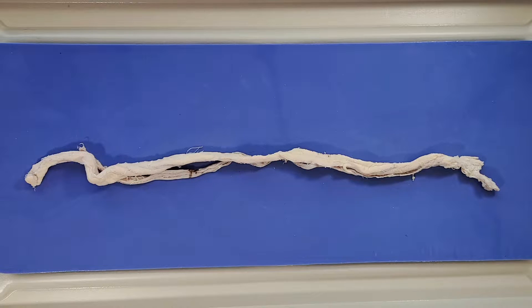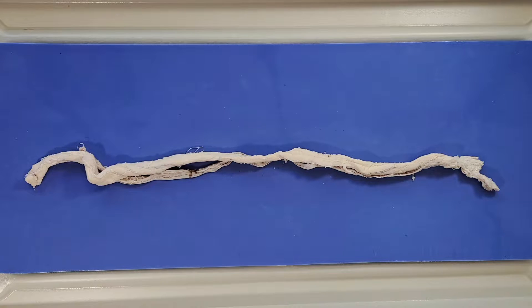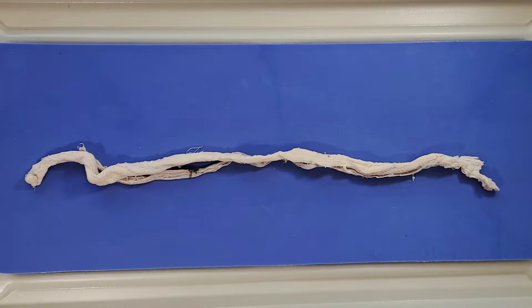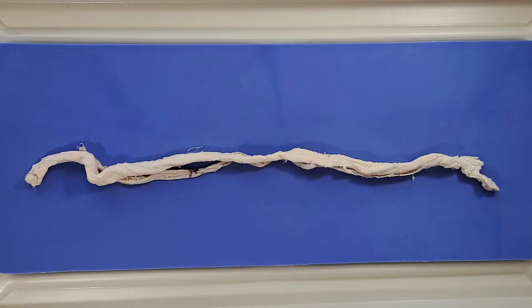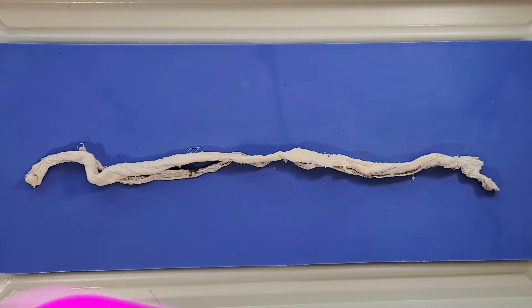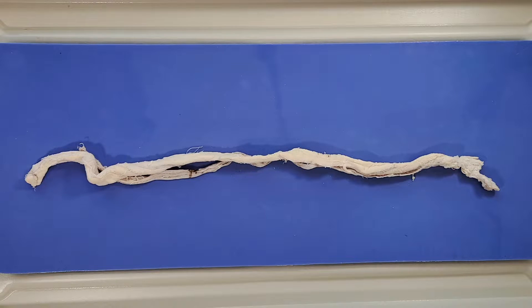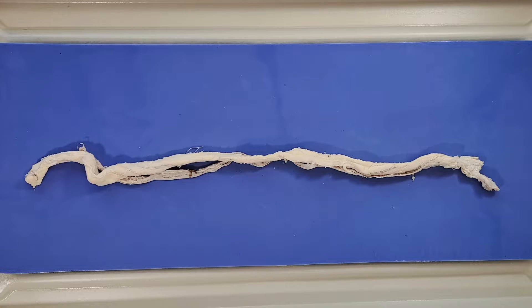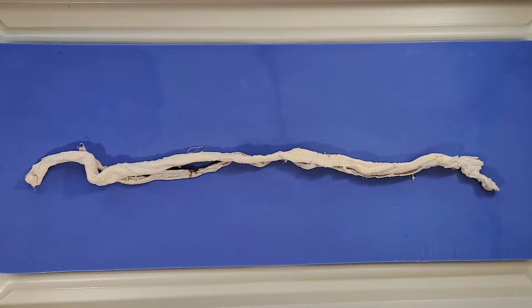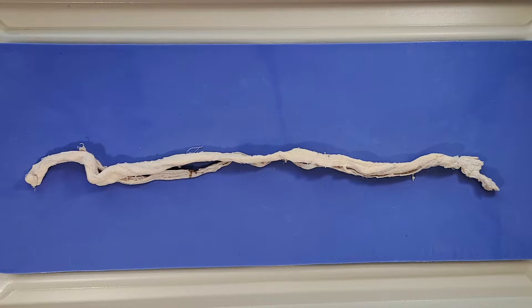The spinal cord is surrounded by the vertebral column which protects and supports it, though this one has obviously been removed from the vertebral column. The spinal cord is also surrounded by three layers of membranes collectively called the spinal meninges. You might remember the meninges from our brain video because the cranial meninges surround the brain. The spinal and cranial meninges are actually continuous with each other and consist of the same three meningeal layers.